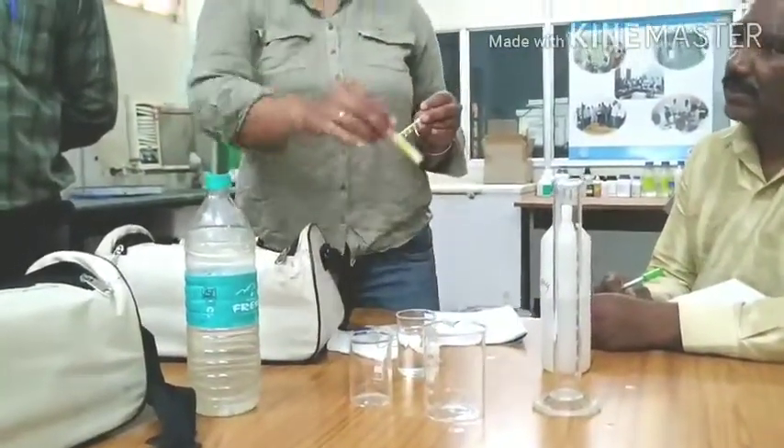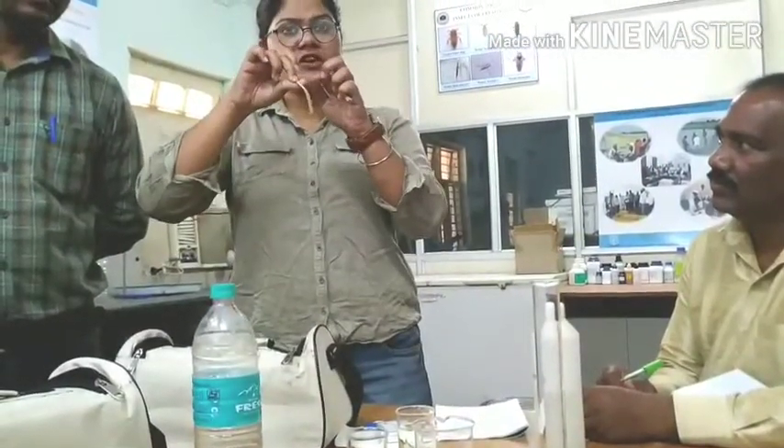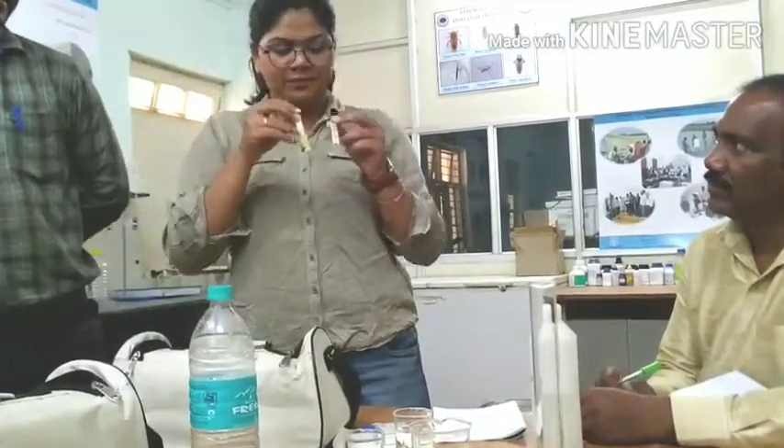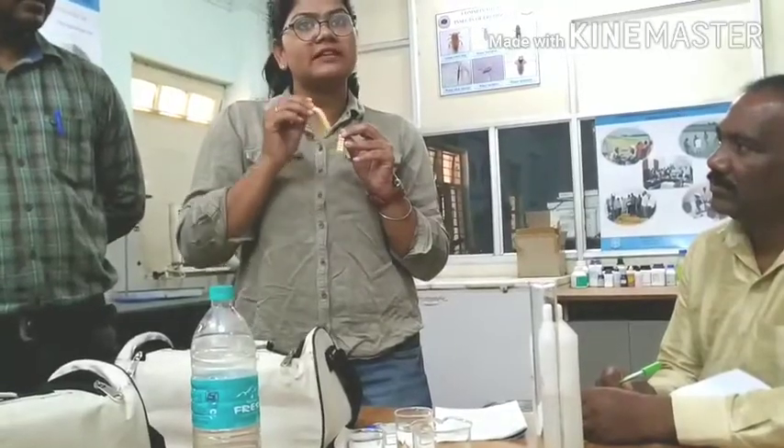After 2 minutes, it's a color. This is yellow color and orange color. That color will change into the scale. It's blue color, so your pH is normal — that is 7.